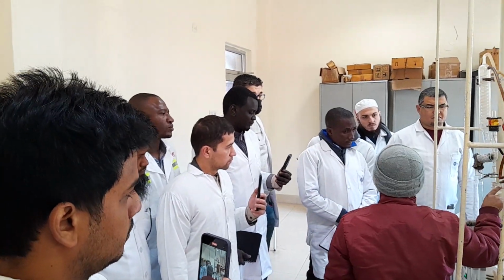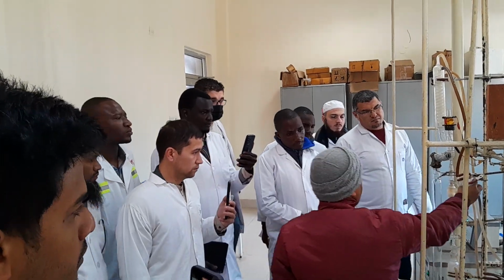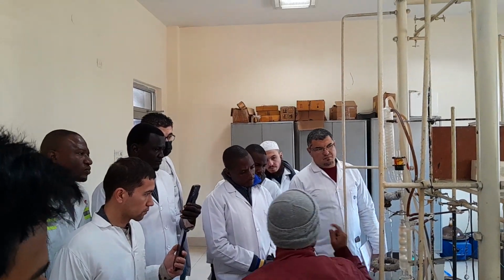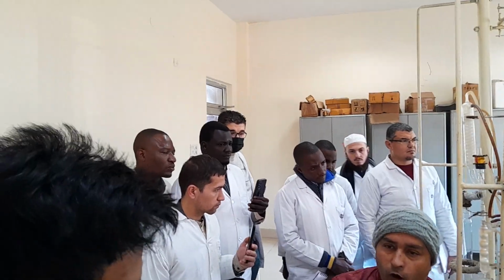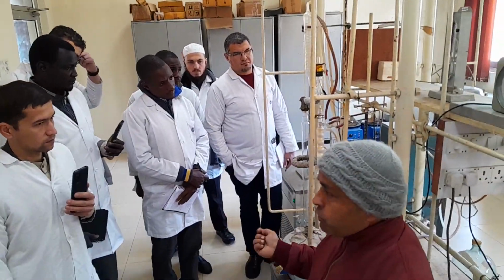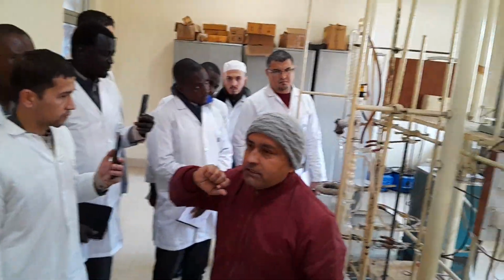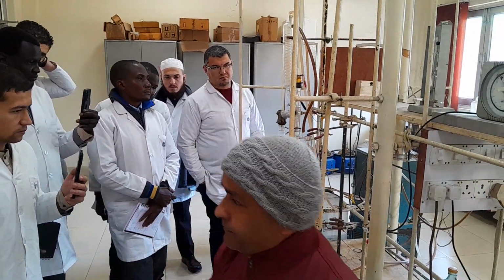There will be a stopper, and you will keep the balloon like this over here and then heat up the crude oil. Now at minus 20 degrees centigrade, how will you come to know that my C1 to C4 has been completely removed from the crude oil? As I told you, my condenser will be at minus 20 degrees centigrade. How do I come to know? When C5 comes, when that C5 vapor touches this condenser, because the condenser is at minus 20 degrees centigrade, that C5 will convert into liquid. Okay.